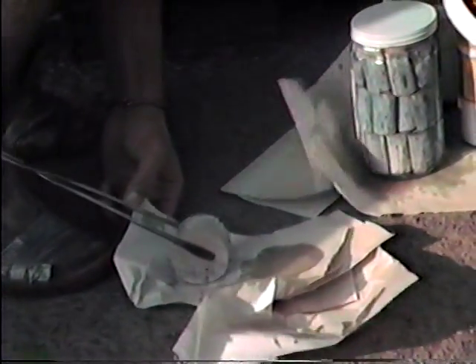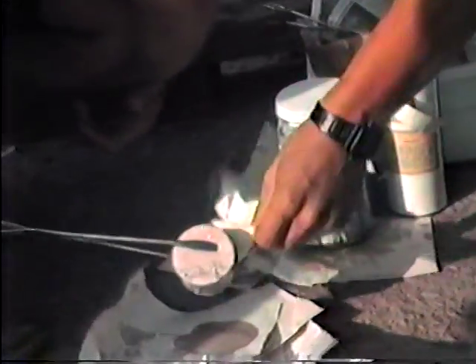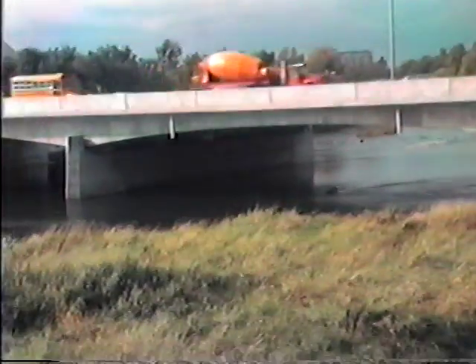Everybody see the chunk of sodium, which is a little bit bigger than what we used in the lab. Now take any pieces of paper that are lying around and wrap them up, because we're going to have to evacuate as soon as this is over. I'm going to move to the other side here — Chris, wait till I get you in the camera. Now I want you to toss this. See where that maple leaf is? Toss it a fair, reasonable distance. Chris, toss it.